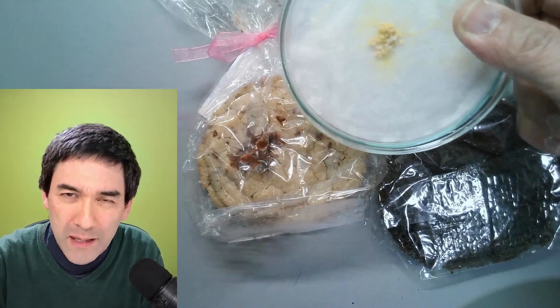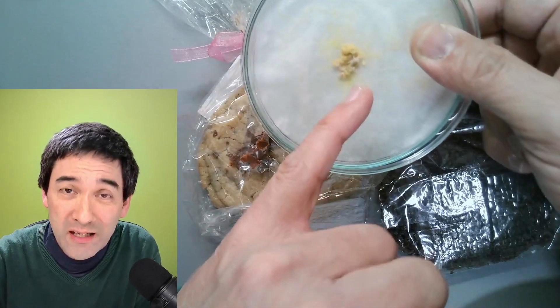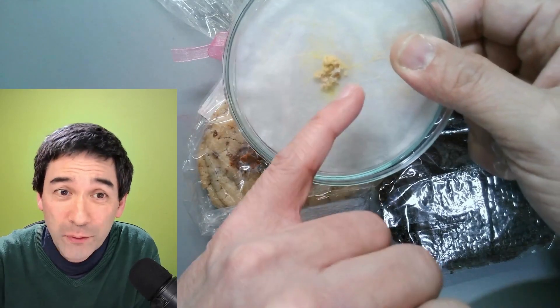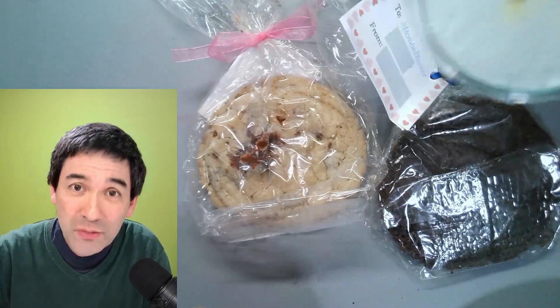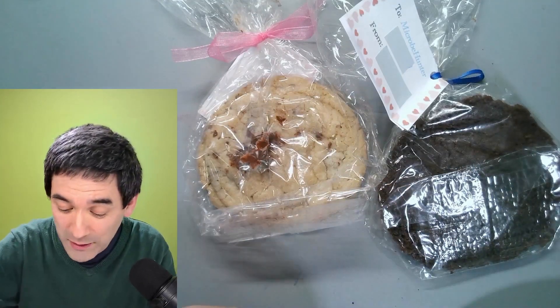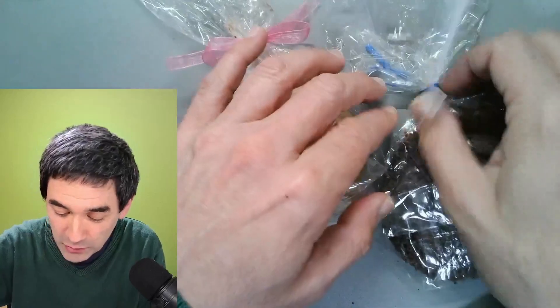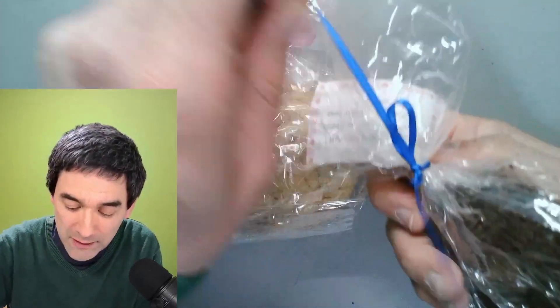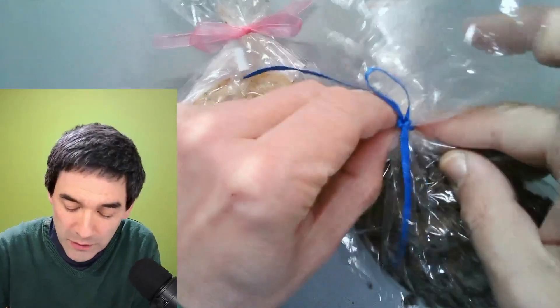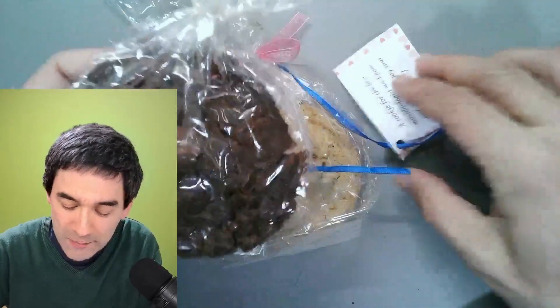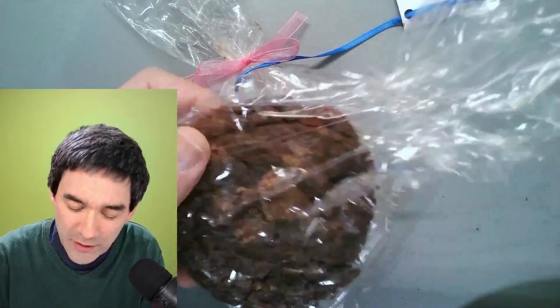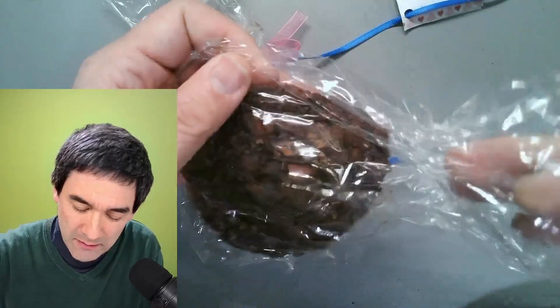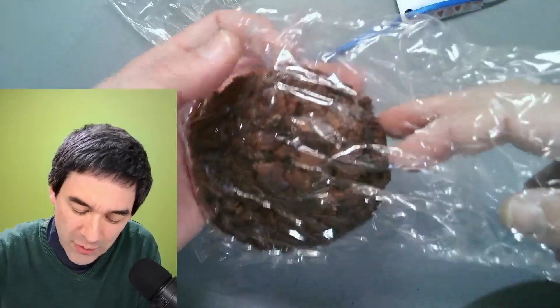But we won't be able to figure that out today because it does take a day for the slime mold to choose the cookie. So this will be a follow-up video. What I'm going to do first is unpack it and put it under the stereo microscope, probably maybe also under the compound microscope.